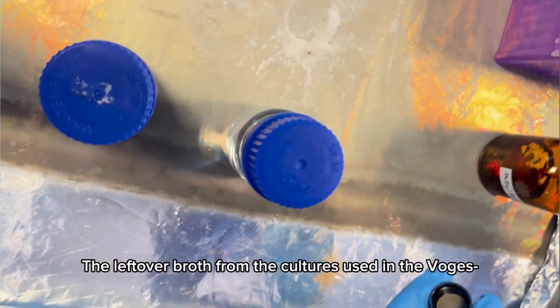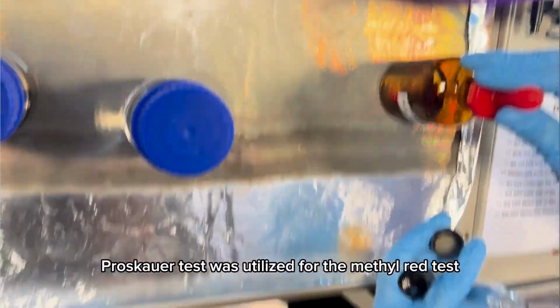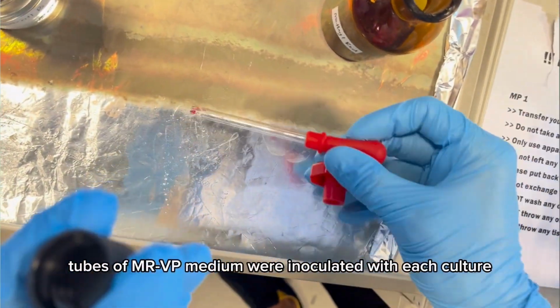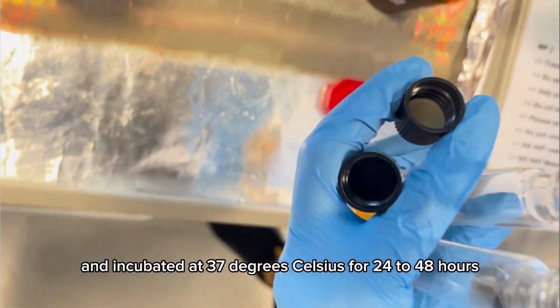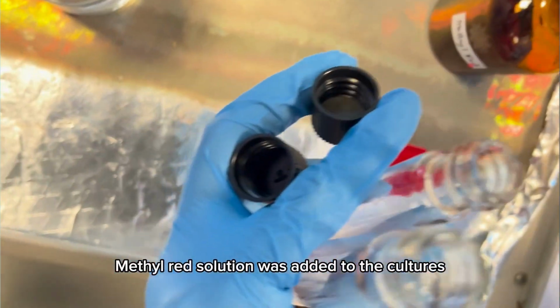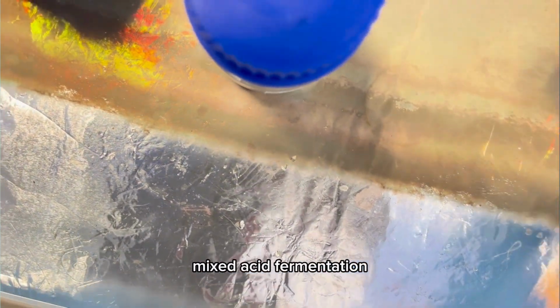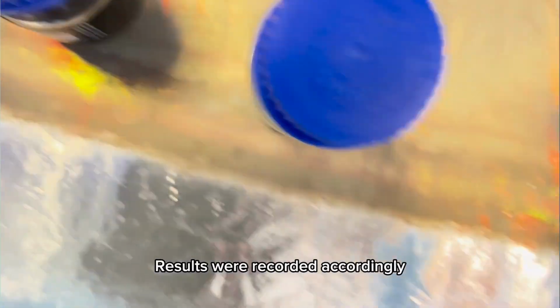The leftover broth from the cultures used in the Voges-Proskauer test was utilized for the methyl red test. If the Voges-Proskauer test had not been conducted, tubes of MRVP medium were inoculated with each culture and incubated at 37 degrees Celsius for 24 to 48 hours. Methyl red solution was added to the cultures and an immediate red reaction indicates mixed acid fermentation, while a yellow reaction indicates a negative test. Results were recorded accordingly.